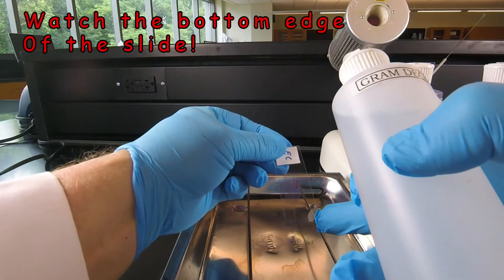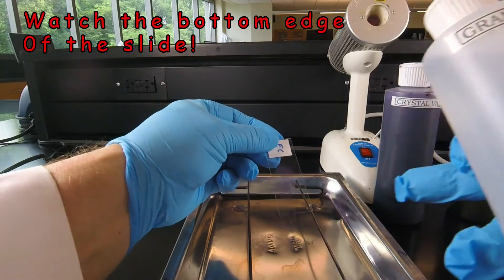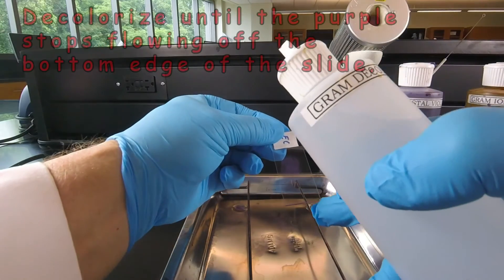But we're going to be watching the bottom of the slide, not the smear. We're going to watch the decolorizer come off the bottom, and we'll do that until the purple stops flowing off the bottom of the slide.